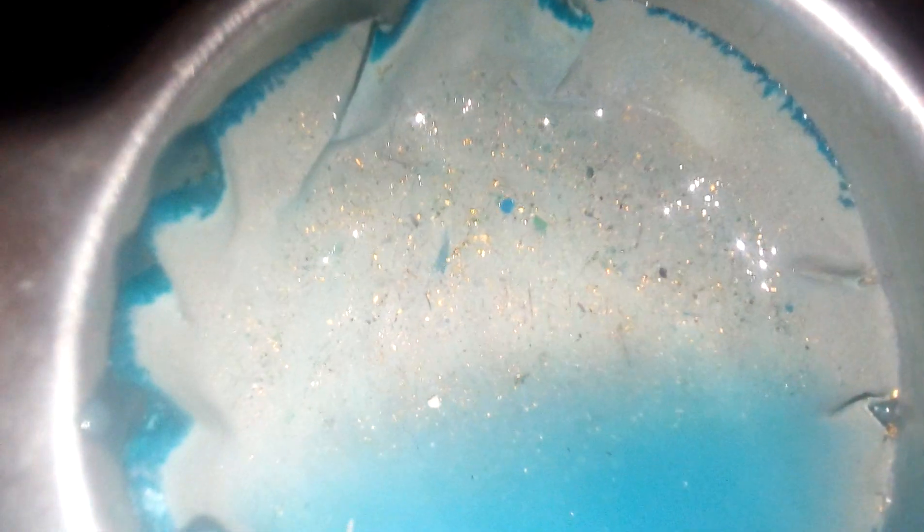Hey, it's Dragometals here. Today I'll be checking up on my latest Peracetic Acid recovery. So I've started filtering off the liquid — there's not too much left. Let's have a little swish of that so you can see the gold material in there. See all that material there. An amount of gold has been recovered from the mobile phone PCBs.